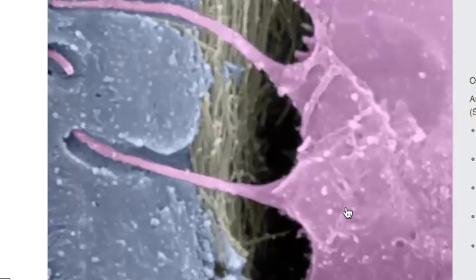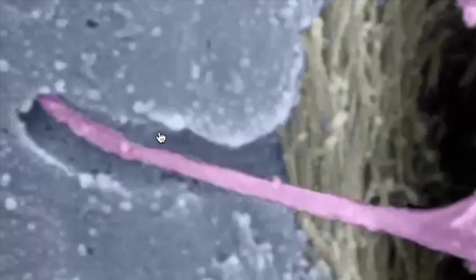So with bone tissue, right around the lacuna, you're going to see these canals, right? These little bores through the extracellular matrix, and the osteocytes' arms, these little cytoplasmic extensions right here, travel through these little canals right here. These little canals through the matrix are called canaliculi. Right? They're the spaces.